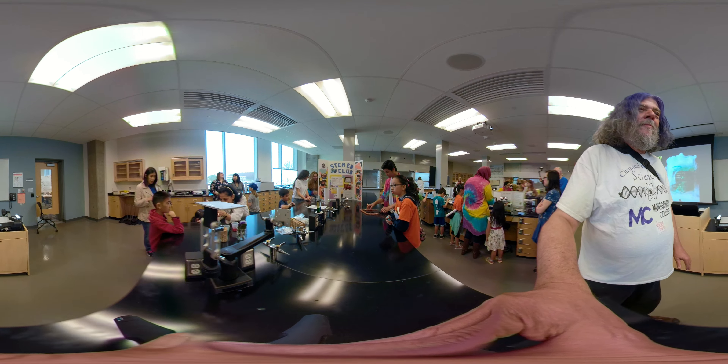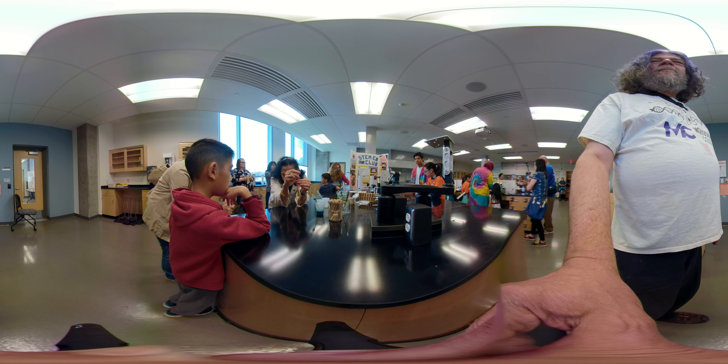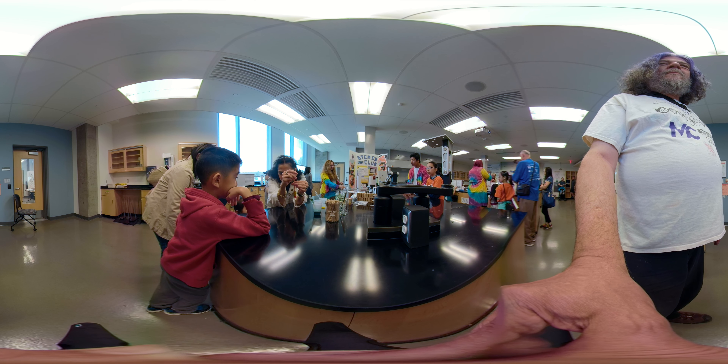There's yellow. I'm going to go down this side, at the very bottom, and I'm just going to go slowly. Do you see the red at the bottom? The color mixes very quickly — it's not mixing. It's more not mixing.